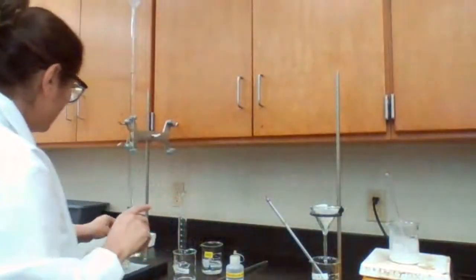So I'm going to perform the experiment for the second trial. New flask.